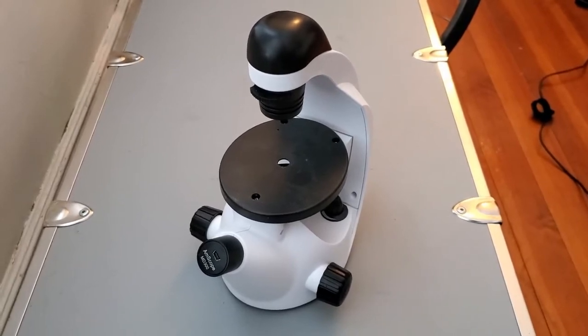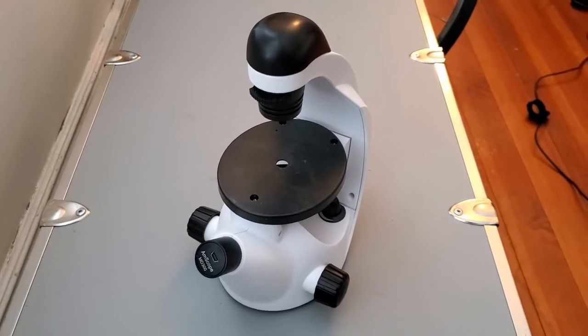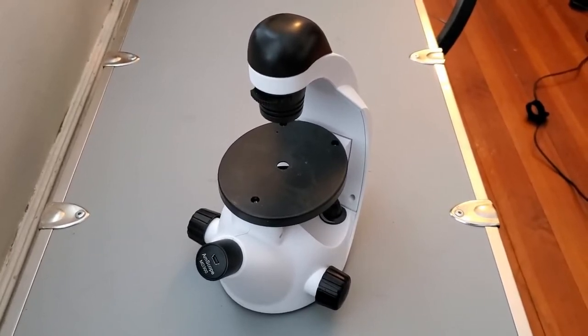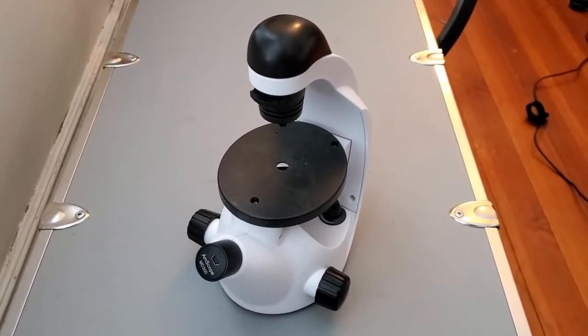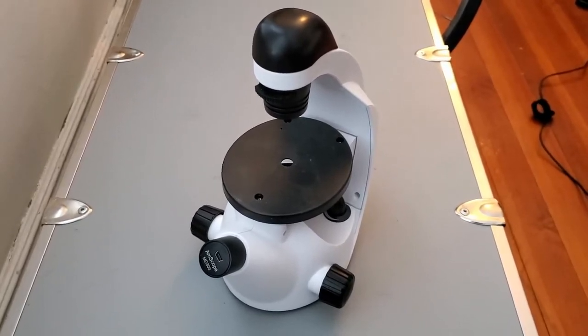So here we have the inverted microscope. This is something that you'll definitely want if you're doing any cell imaging, but also just if you're doing cell culture. This can be pretty useful as well, so going over the basics of this.